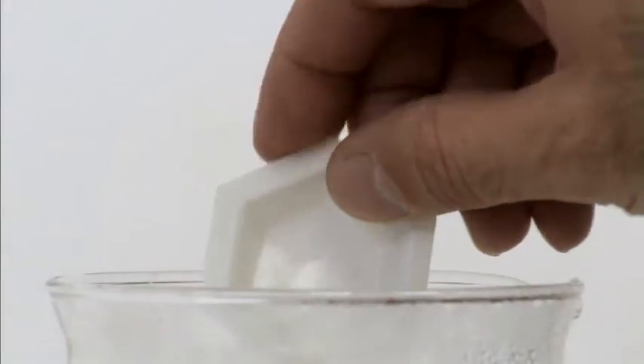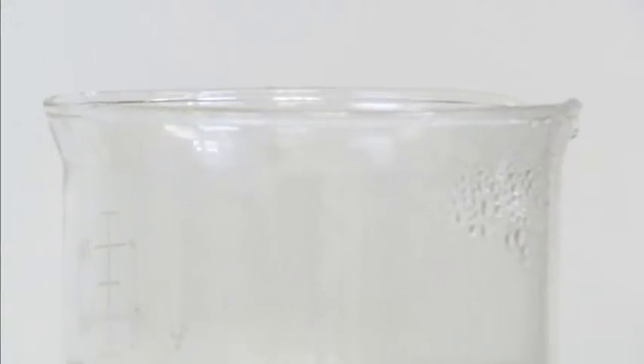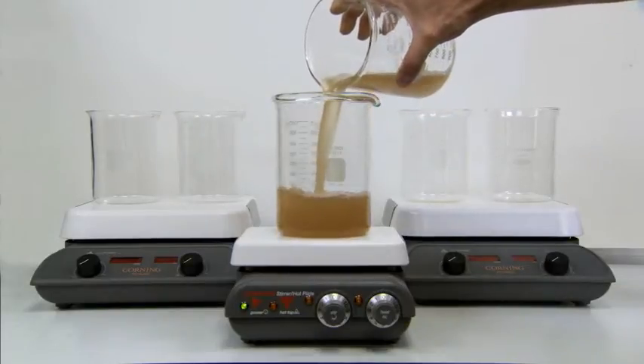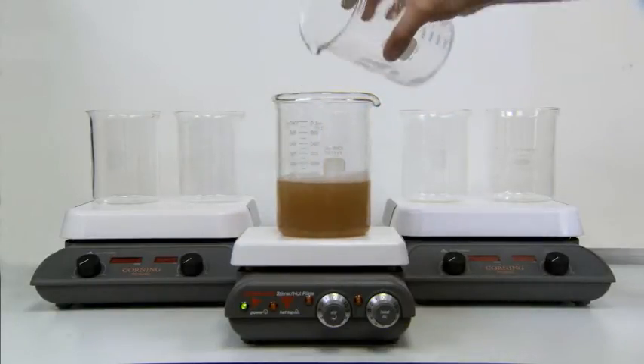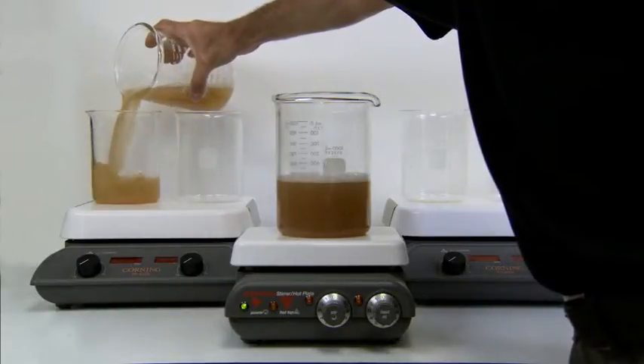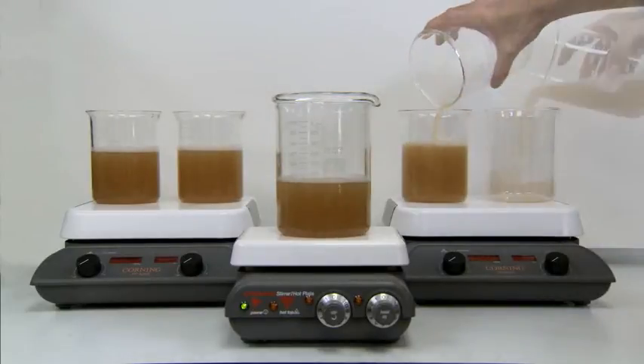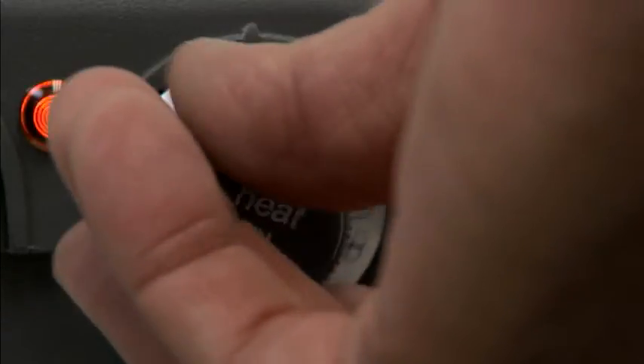In this demonstration, we see the clarifying effect of Ashland's Polyclar Brewbrite Wort Clarifier and Beer Stabilizer. This method optimizes the dose rate of Polyclar Brewbrite Stabilizer required to clarify the wort and absorb tannoids from the wort. Wort contains both polyphenols and proteins, which can cause haze in the beer. Polyclar Brewbrite Stabilizer clarifies wort through the action of carrageenan, which combines with the basic protein and absorbs polyphenol through the action of PVPP, resulting in a clearer, stabilized, finished beer.